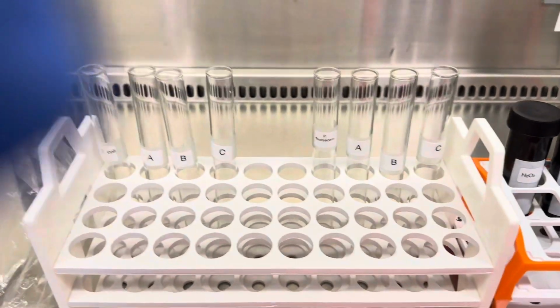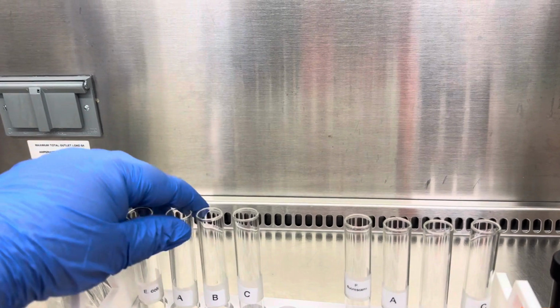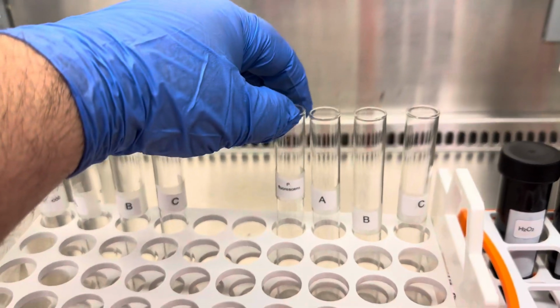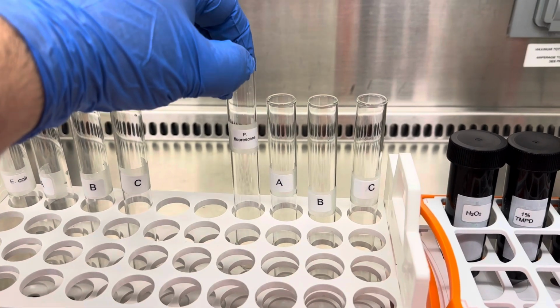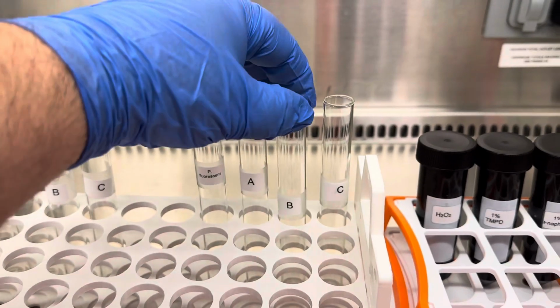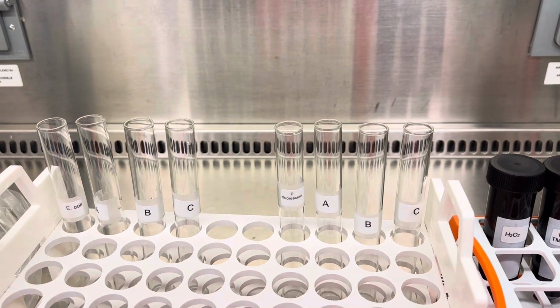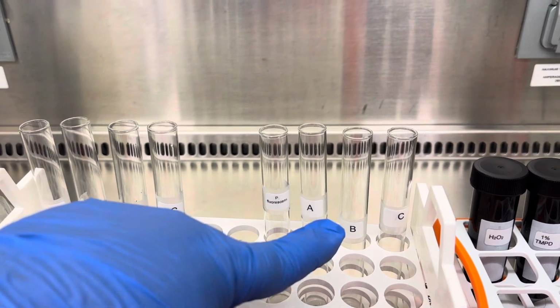So what I've done, so we can save some time, is I have already pipetted the chemicals. Those tubes contain 0.5 ml of hydrogen peroxide. And then these tubes here contain TMPD, which is this brownish reagent, and 1% naphthol or alpha naphthol, which is actually clear. So what we're going to do is add bacteria to these tubes, and then vortex them, and then we're going to be able to assess whether they're catalase positive or oxidase positive, okay?